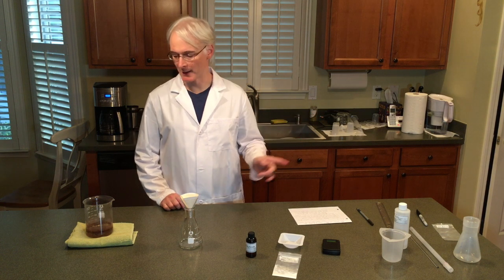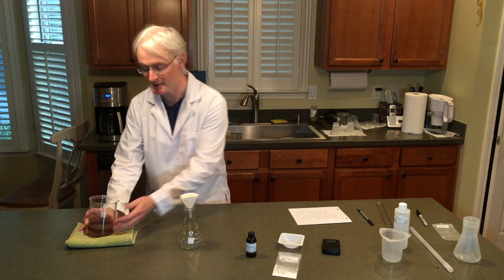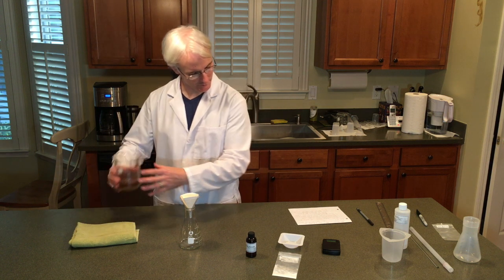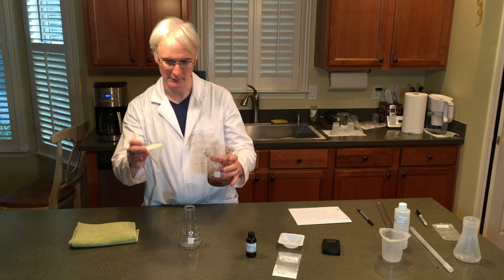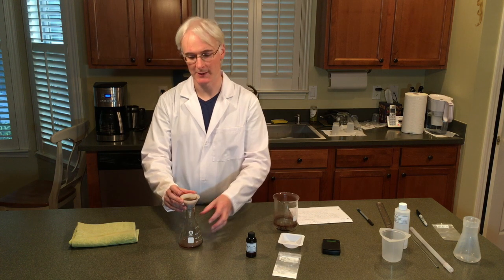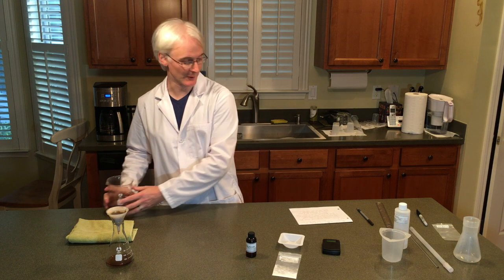After 45 minutes or so, our solution went down from 150 milliliters to 50 milliliters or thereabouts. I've also left it for another 15 minutes so it's at room temperature. You'll see that it's a murky liquid solution, but this is our iron 2 acetate. We're going to take the iron 2 acetate solution from the 600 milliliter beaker and filter it through the filter paper set up in the funnel and into the Erlenmeyer flask. While this is draining, I'm going to wash the 600 milliliter beaker — we're going to be using it again for the next part.